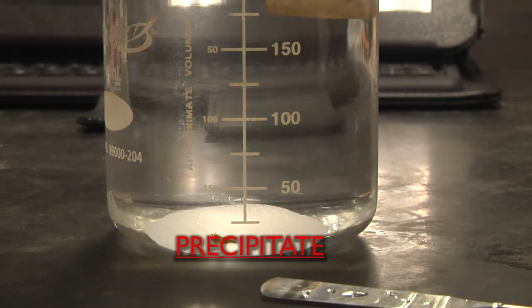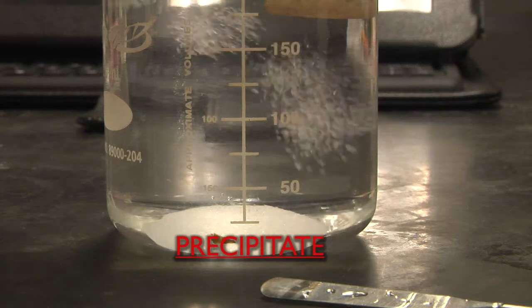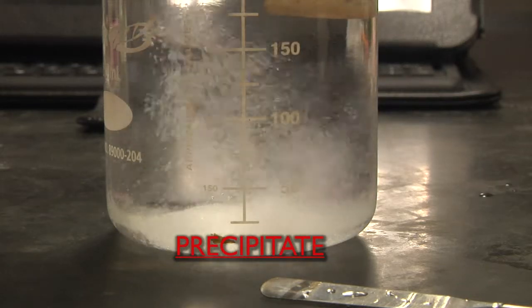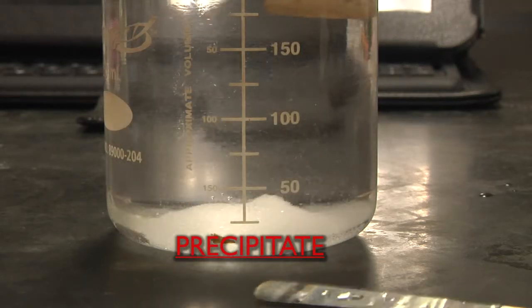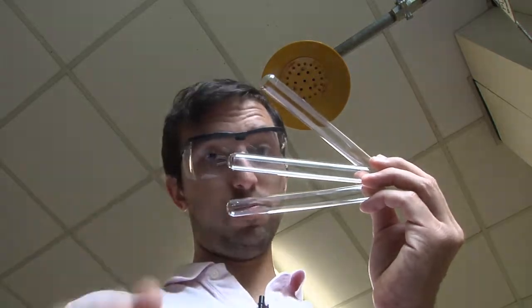Any additional salt that is added will not be able to dissolve and will only fall to the bottom as a precipitate. Okay, let's get started. We will need to clean and dry three test tubes.